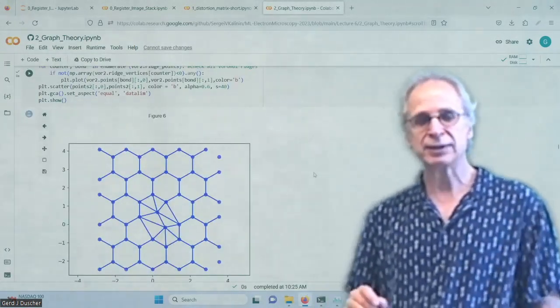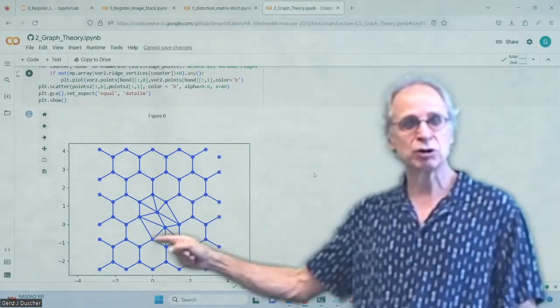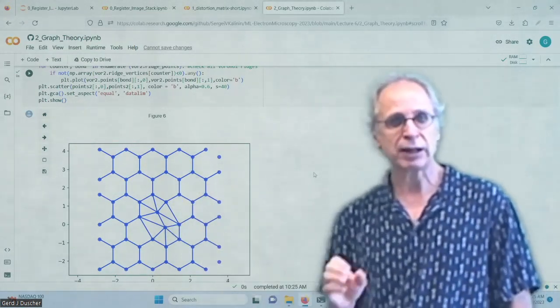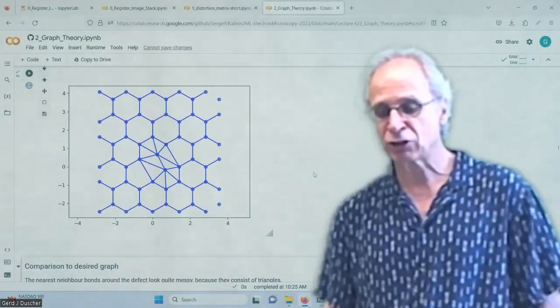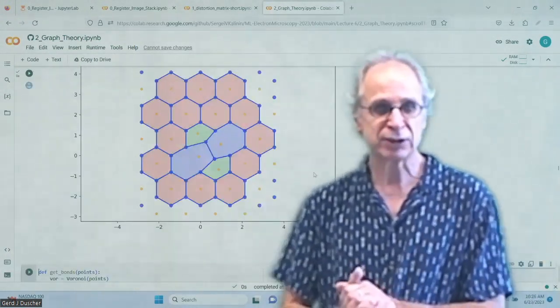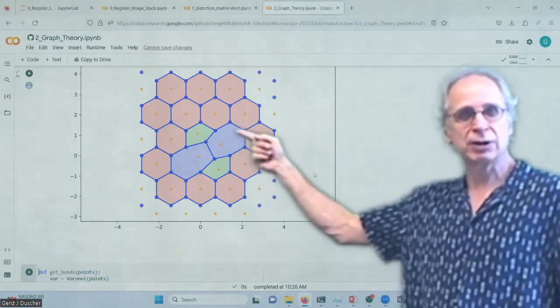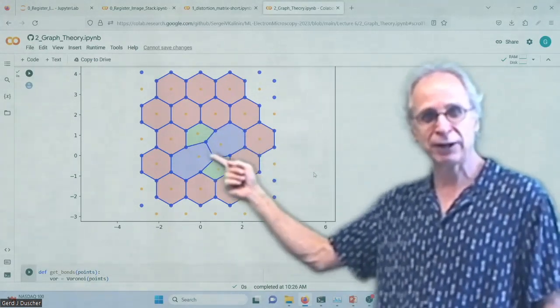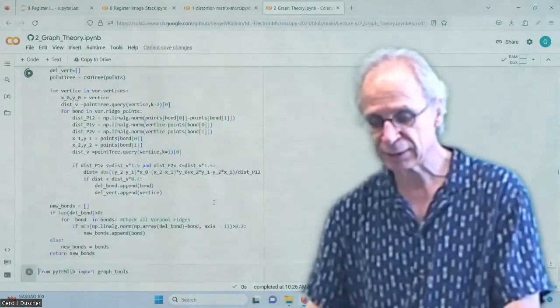And if I do my analysis now, without any kind of fancy thing, it will make me a mess, right? And I will see immediately where the defect is. Okay, it could be enough, but we want to know which kind. And so the desired graph is, of course, this one. I want to color them. I want to have all the hexagons in red. I want to have my 7-fold rings in different colors than the 5-fold rings. And so this is what I need.